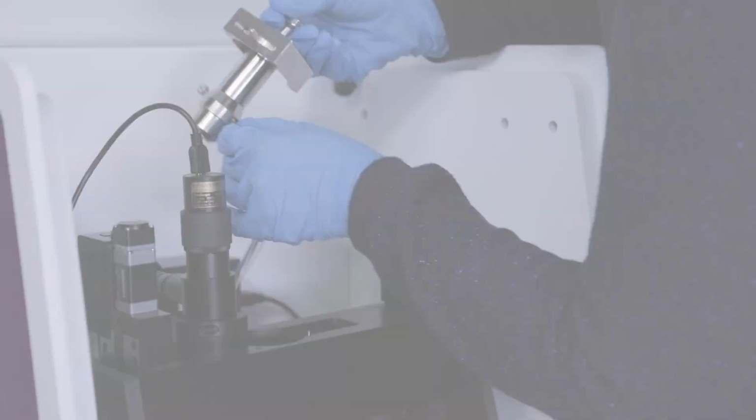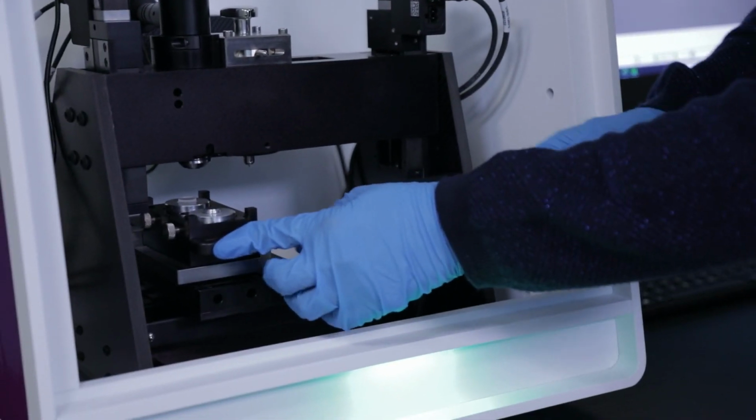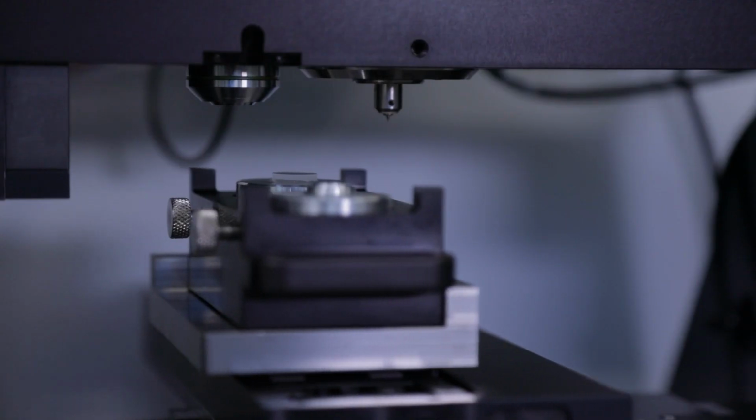The great thing about KLA Instruments is our support network. We support large customers from semiconductor fabs all the way down to their benchtop customers in universities. Universities, they can expect the distribution networks. They can expect the service and timely response of our service personnel when they have an issue. But not only are we looking at service issues, we're also looking at application support. KLA is one of the most advanced technology companies out there. We are supporting semiconductor customers down to measure length scales that have never been considered previously.